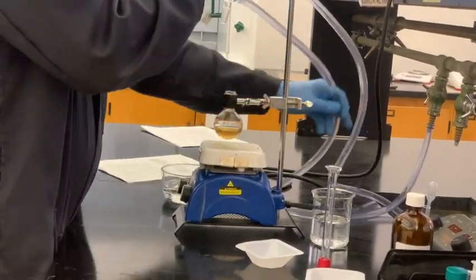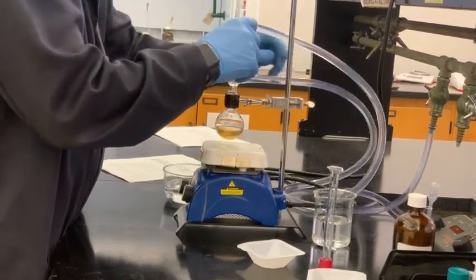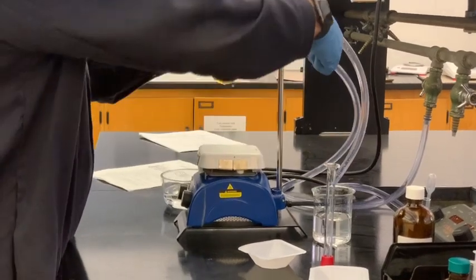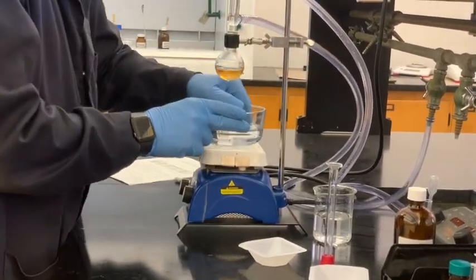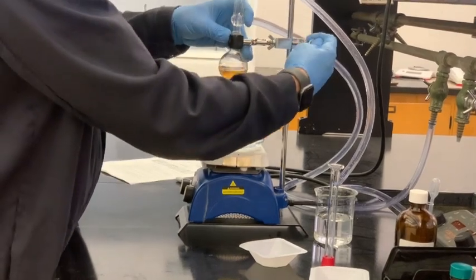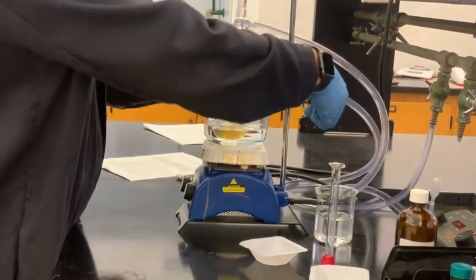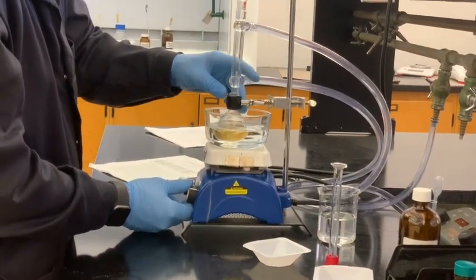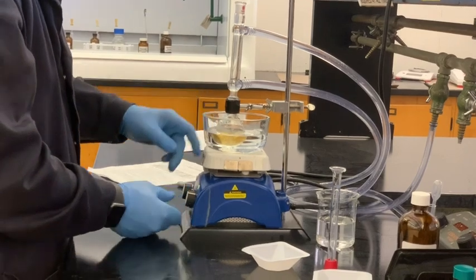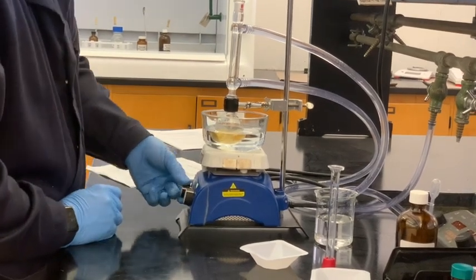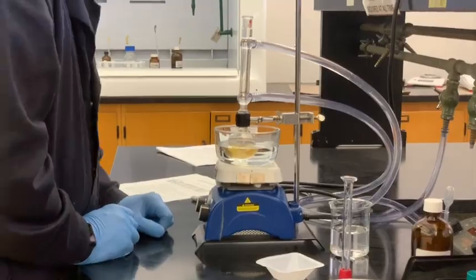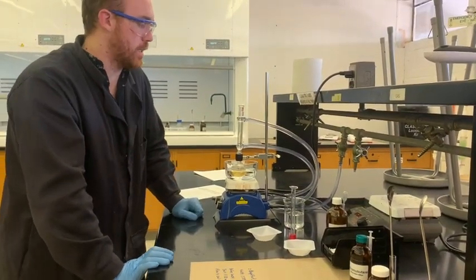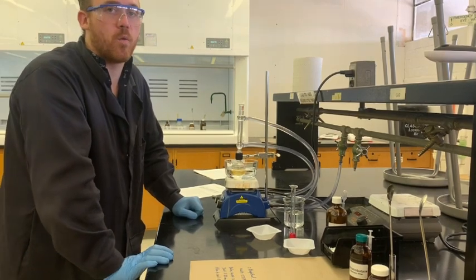Make sure it's not putting too much pressure on the joint. You want to keep that joint nice and comfortable. We're going to lift this up, place our hot bath underneath, replace the flask, and keep it going. I'll keep it the same stir speed and replace it back to four. Everything is reset. You want to keep an eye on this until the reaction reaches steady state again. We're going to let this go for one hour now.